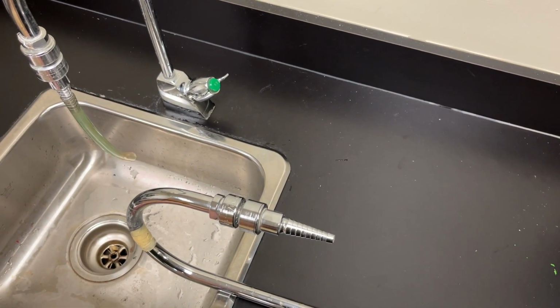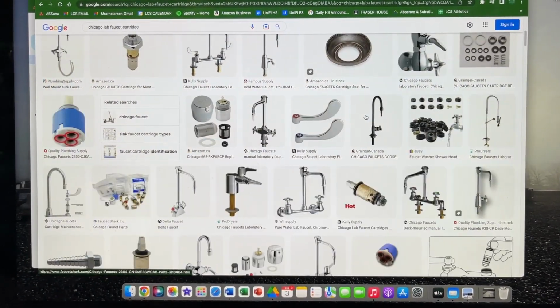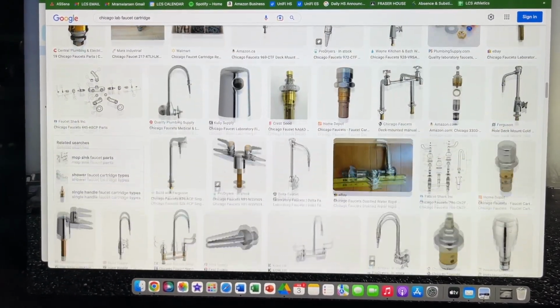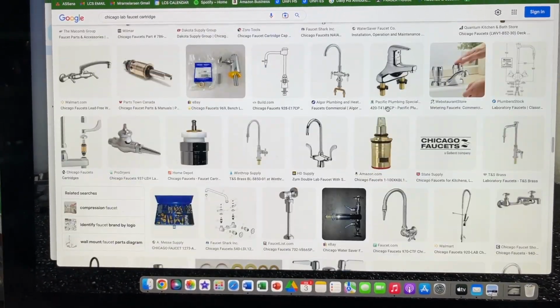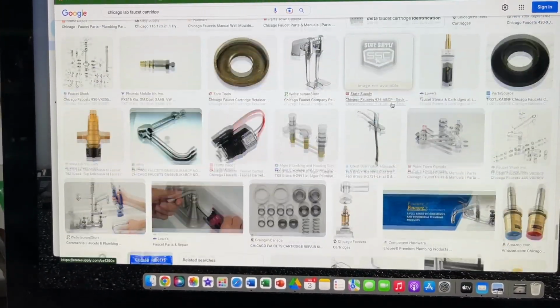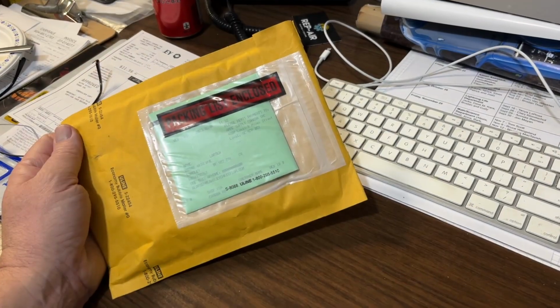That's not so good. So what do you do when you don't have a manufacturer, so you don't have a part number, so you have no idea what part you need to order? Well, it stands to reason that faucet manufacturers don't make their own cartridges, so certain cartridges could be used in multiple faucet types. So you do an image search, and wouldn't you know, my hunch paid off. Look what arrived in the mail today.